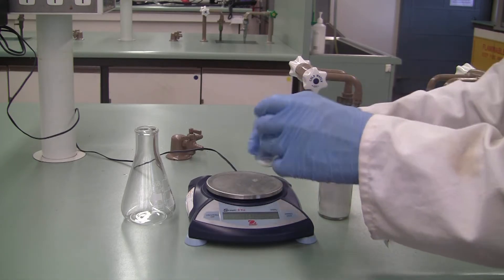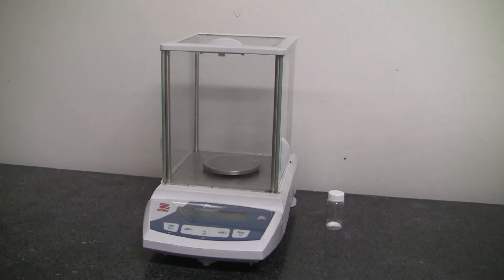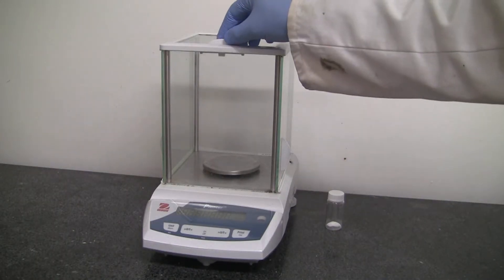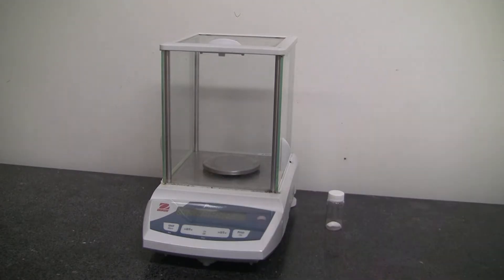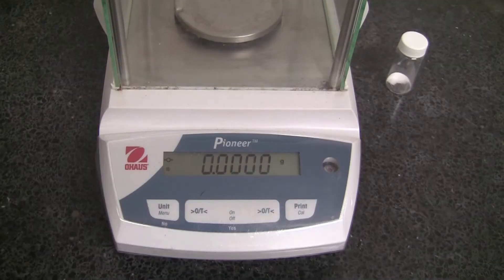Make sure the analytical balance doors are all shut and zero the instrument. After you've done that, double-check to make sure it says zero.